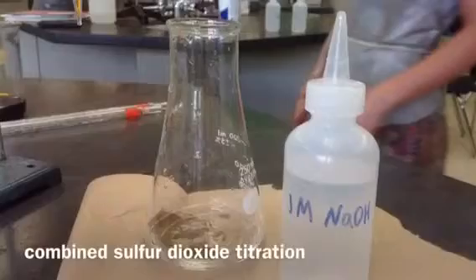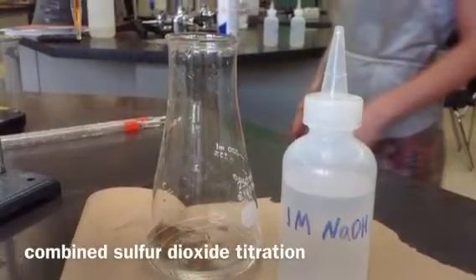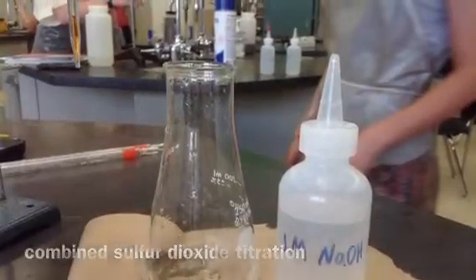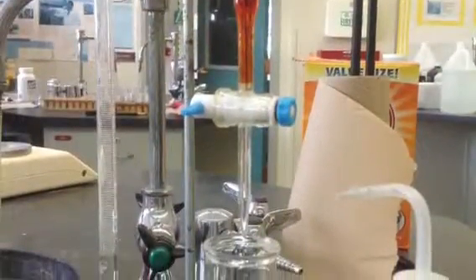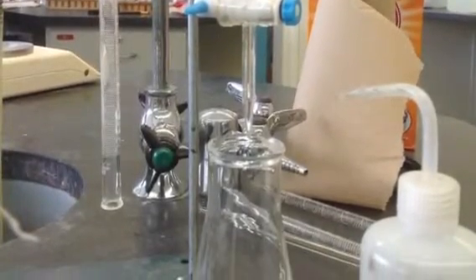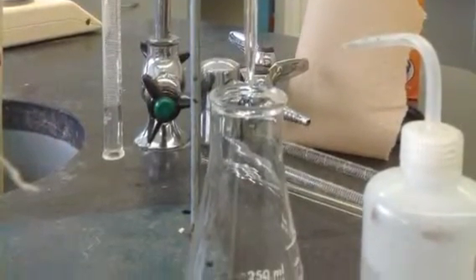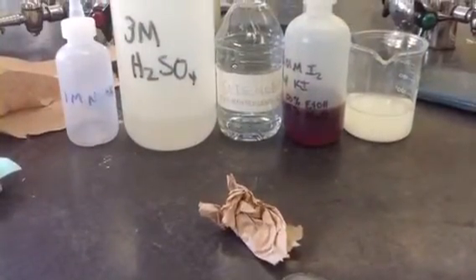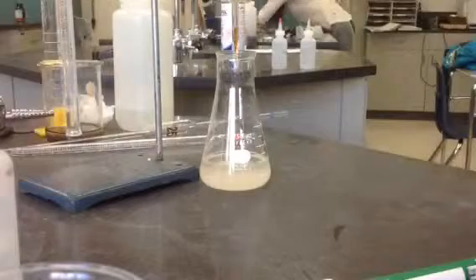To find the amount of combined SO2, I had to first combine 50 milliliters of wine with 25 milliliters of sodium hydroxide. This was done to detach any SO2 that was bound to any other compounds in the wine. After adding 10 milliliters of sulfuric acid and 3 milliliters of starch solution to the wine, I titrated the solution with the 0.01 molar iodine solution.